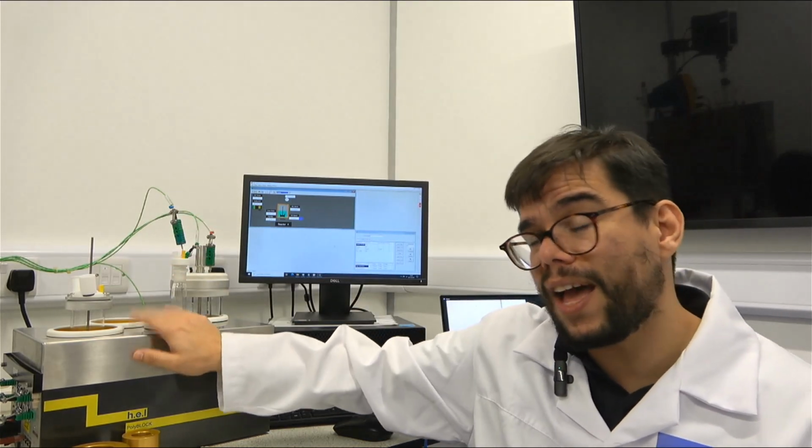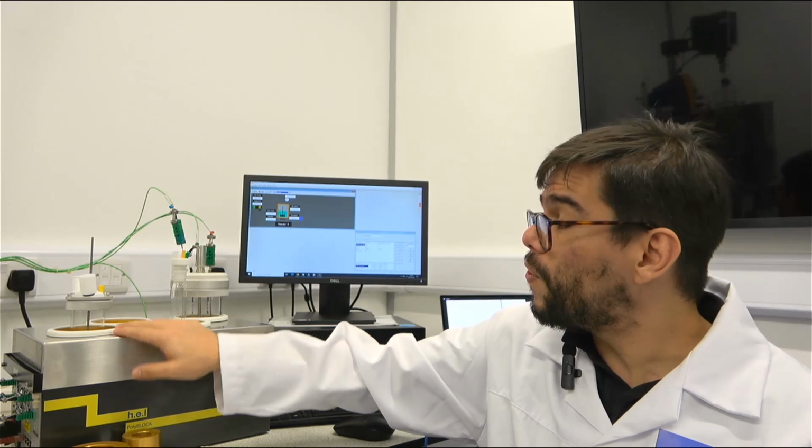Our PolyBLOCK system is H.E.L's solution to increase the high throughput of chemical reactions. Depending on the system, we're going to have as default up to 8 individual reactors that will allow us to test different characteristics and different parameters in real time, increasing the capacity of our research in order to test all these individual variables. But the one that I have with us today is our PolyBLOCK 4, that can hold 4 individual reactors of up to half a liter.